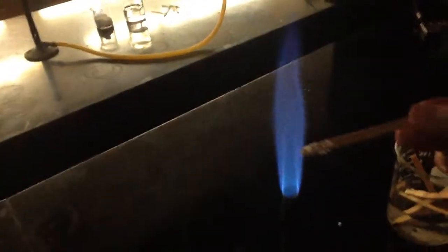Our next one that we are testing is Na — sodium. Stick wet, get the chemical on there, in the flame — for sure bright orange, nothing else, just a flame orange there. Making sure not to get the stick to burn because then all we're going to see is the orange from the stick burning.